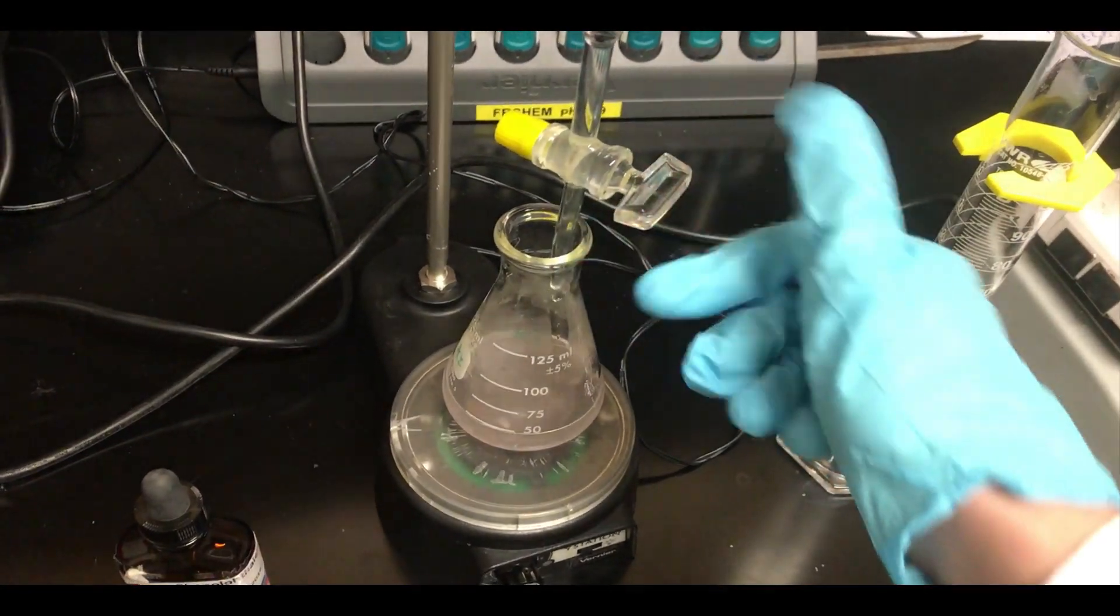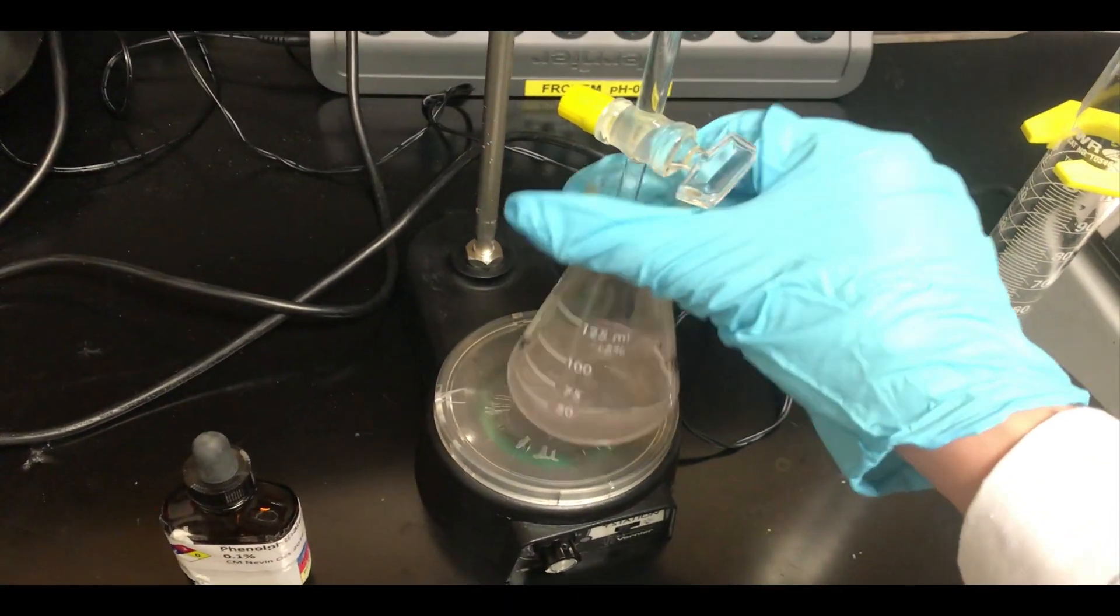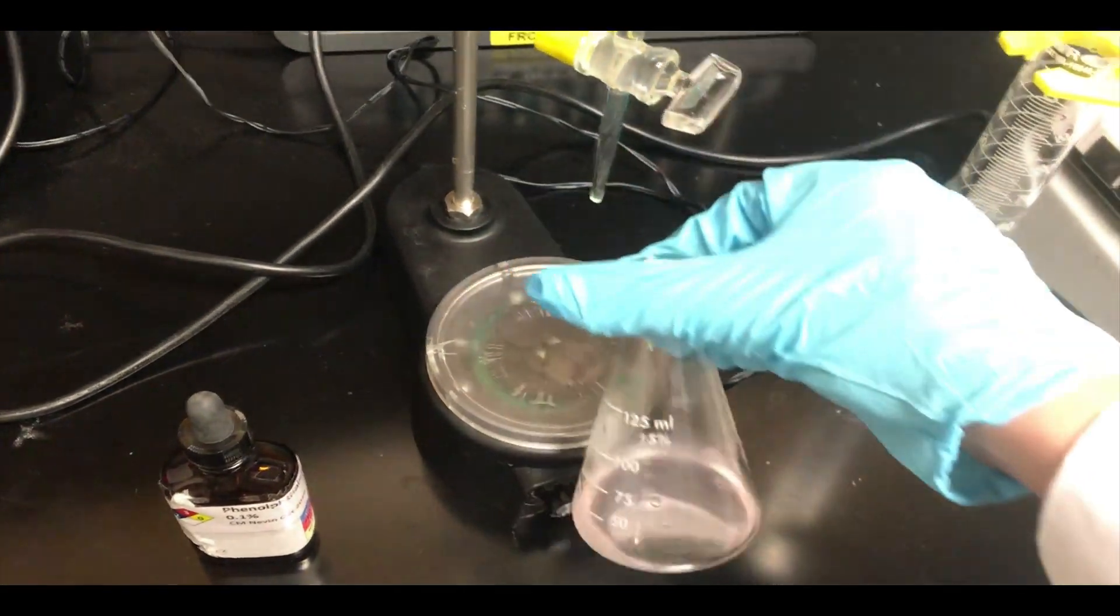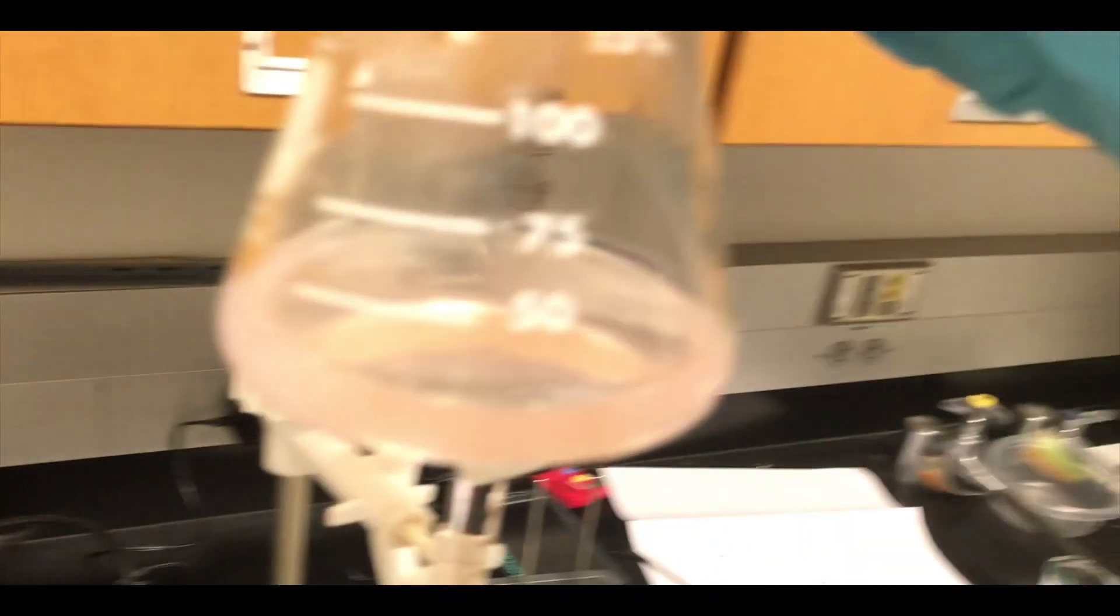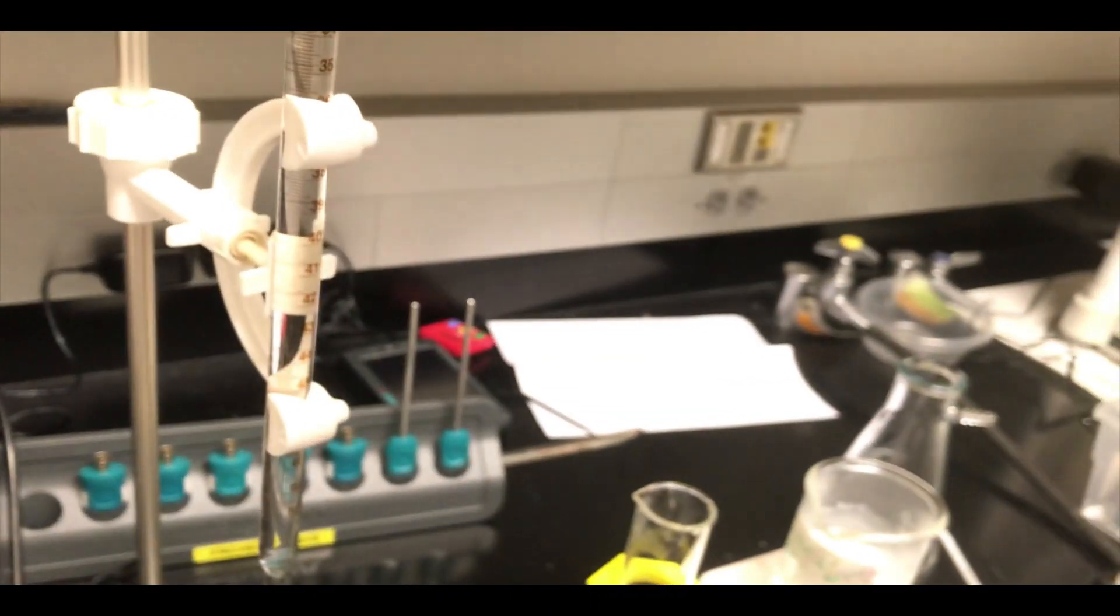All right, so we've now reached a point where the deep pink color has gone away. We are at the end point of the titration, and there's a nice close-up of the solution. It's still a little bit cloudy because of excess magnesium hydroxide. That's okay.